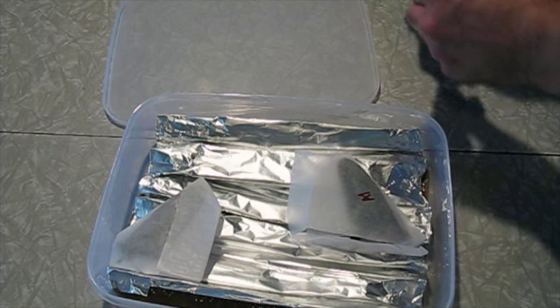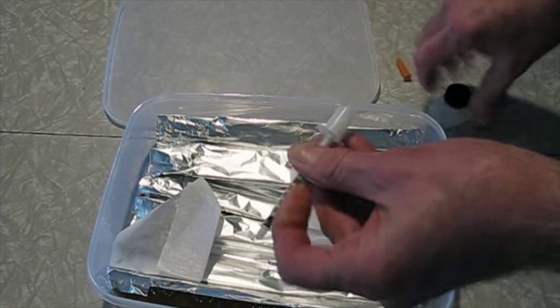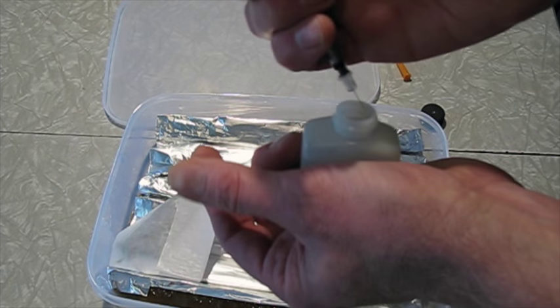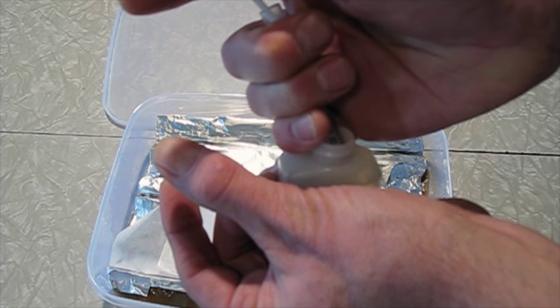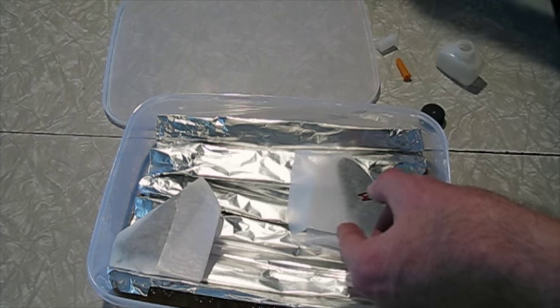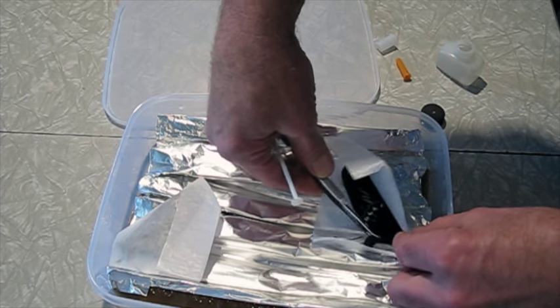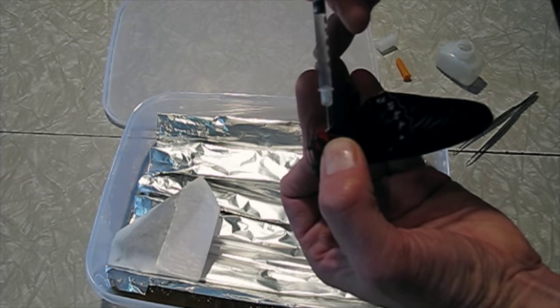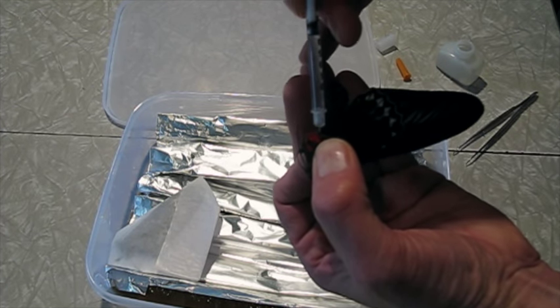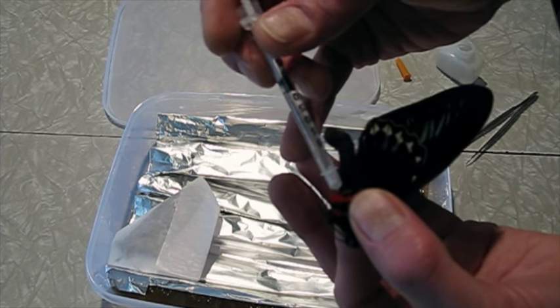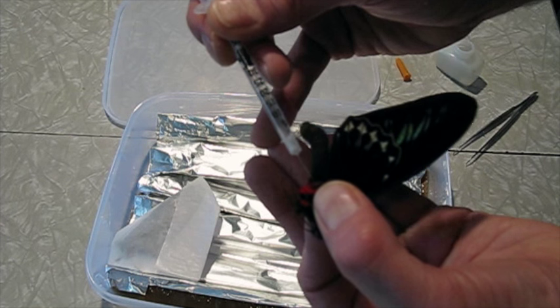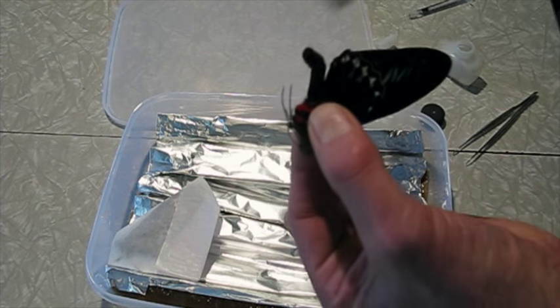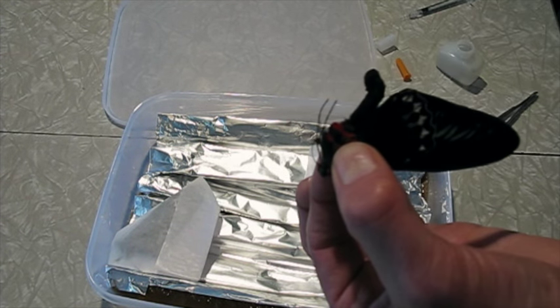Typically if the butterfly has been very dry, they're a little bit fragile. You can just set the envelope on top of the foil like this. Usually I'll let this sit for maybe a day just like this to soften them up. Once the butterflies have been in the chamber for a little while, and we want to relax the wings, I use an insulin syringe and a little bit of just plain tap water. Then we grasp the butterfly by the thorax, and just behind the back legs where the abdomen joins the thorax, you can stick a needle in right into the thorax and just inject a little bit of water into it. This water inside the thorax will soften the wing muscles.